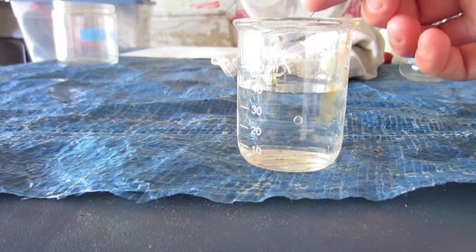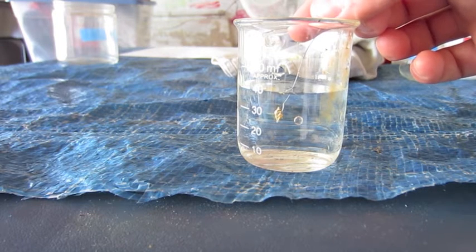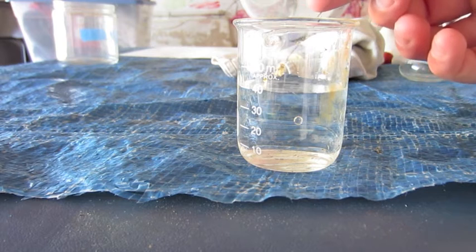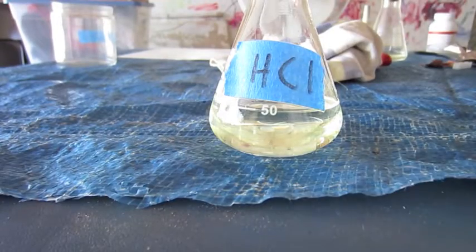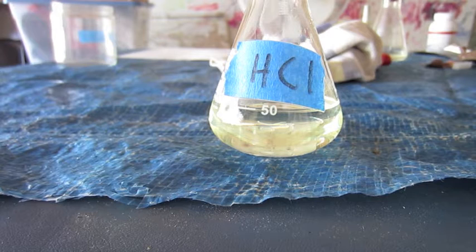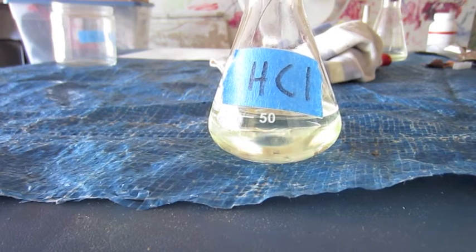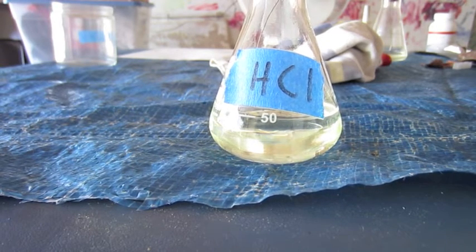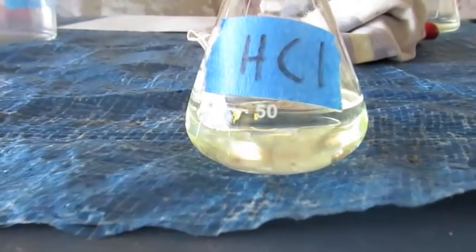Now, it's pretty obvious gold won't react with water, but just to be scientific, I decided to put some gold foil in water and demonstrate that it doesn't react. And there you go, it's at the end of inoculating wire, and it doesn't react. And now, just to be scientific again, I'm going to put some gold foil into some hydrochloric acid. Kind of hard to see, but there is some gold foil in there. It's floating on the surface. There we go, I'm zooming in. Oops, the camera didn't focus, but there you go, you see gold.